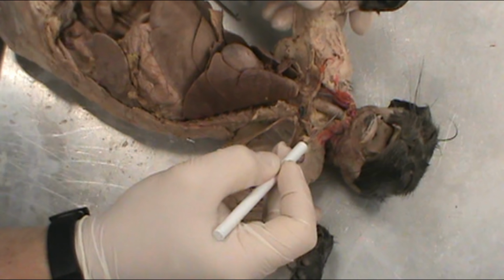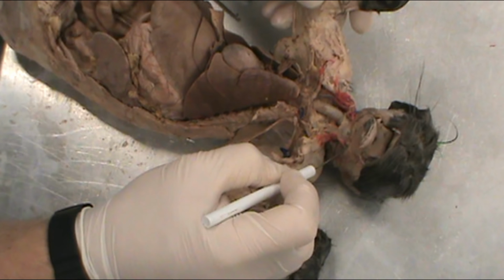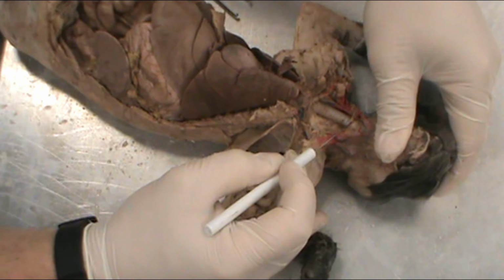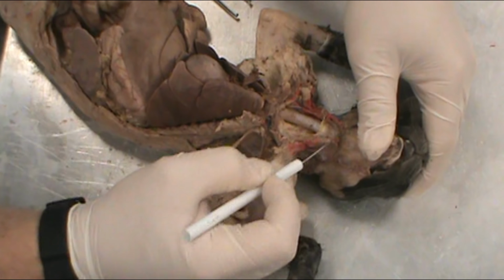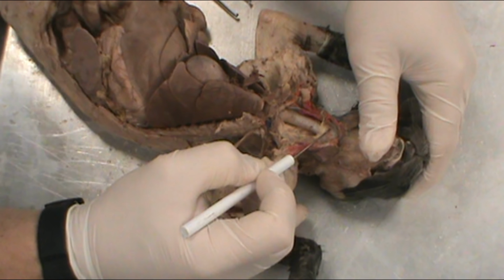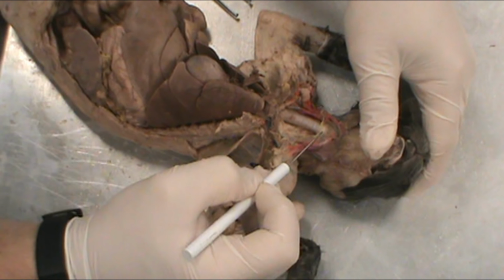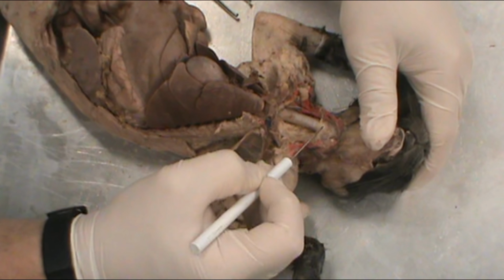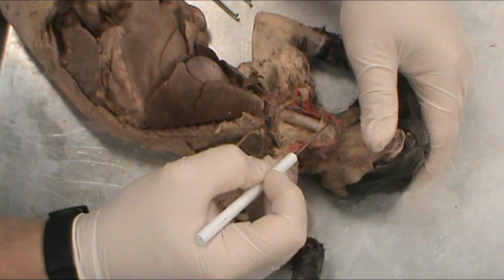All right, so this is the trachea, this tube that comes down through the throat right here, and sitting up on top of the trachea, you can see the larynx. You can see where the cartilage gets thicker. You have this darker color. So we can see the cartilaginous rings that are in the trachea. And then here you see this darker part up on top, and that is the larynx or voice box for the cat. I guess you could call it the meow box for the cat.